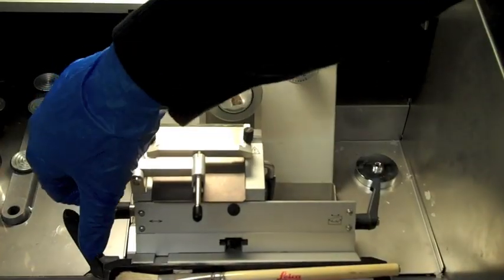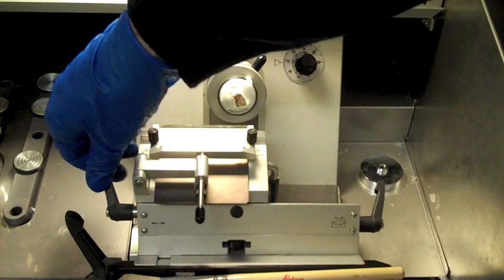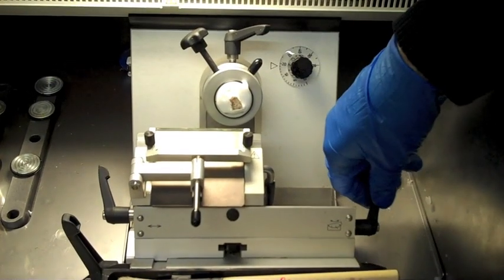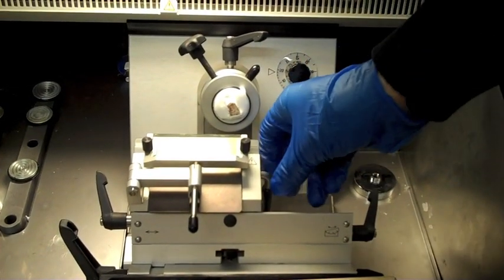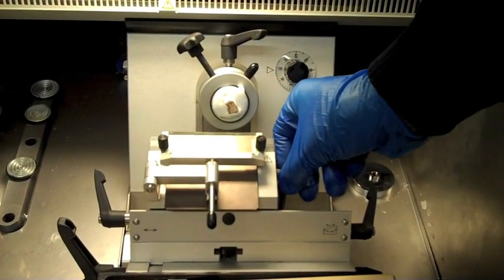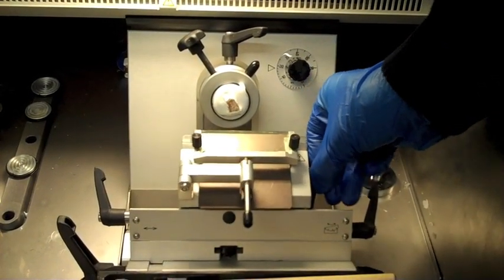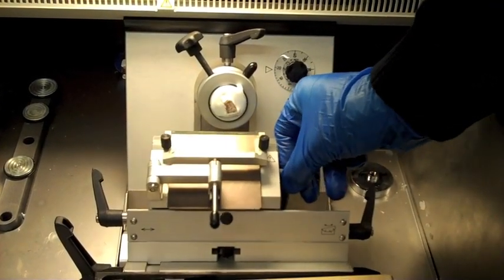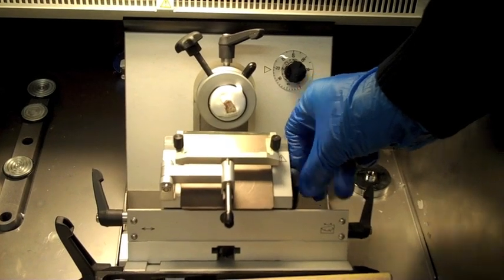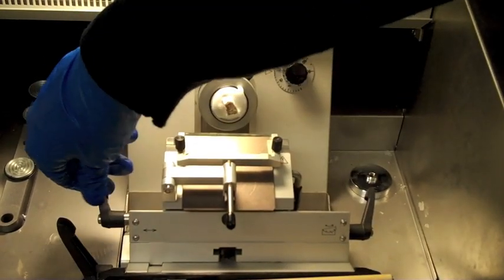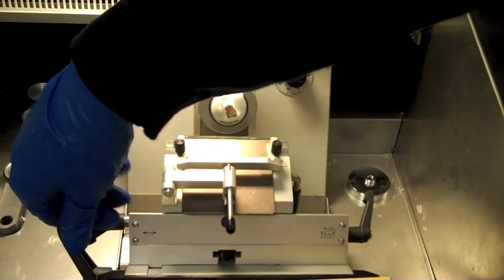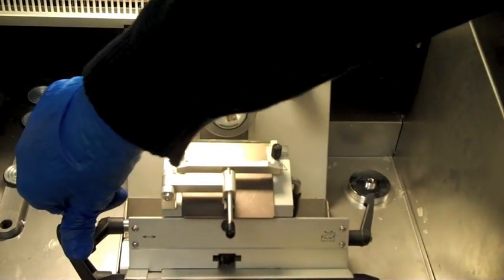You can adjust the position of the blade with the lever on the left. If the razor becomes dull after a long cutting session, you can change the position of the blade or ask the TA to put in a new one. Make sure to tighten the lever when you are done.